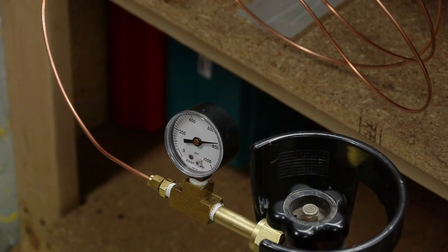It's reading about 750 psi, which correlates to a temperature out here of probably about 70 degrees F. It'll stay at 750 psi if the temperature stays the same as I draw down the liquid out of that tank.